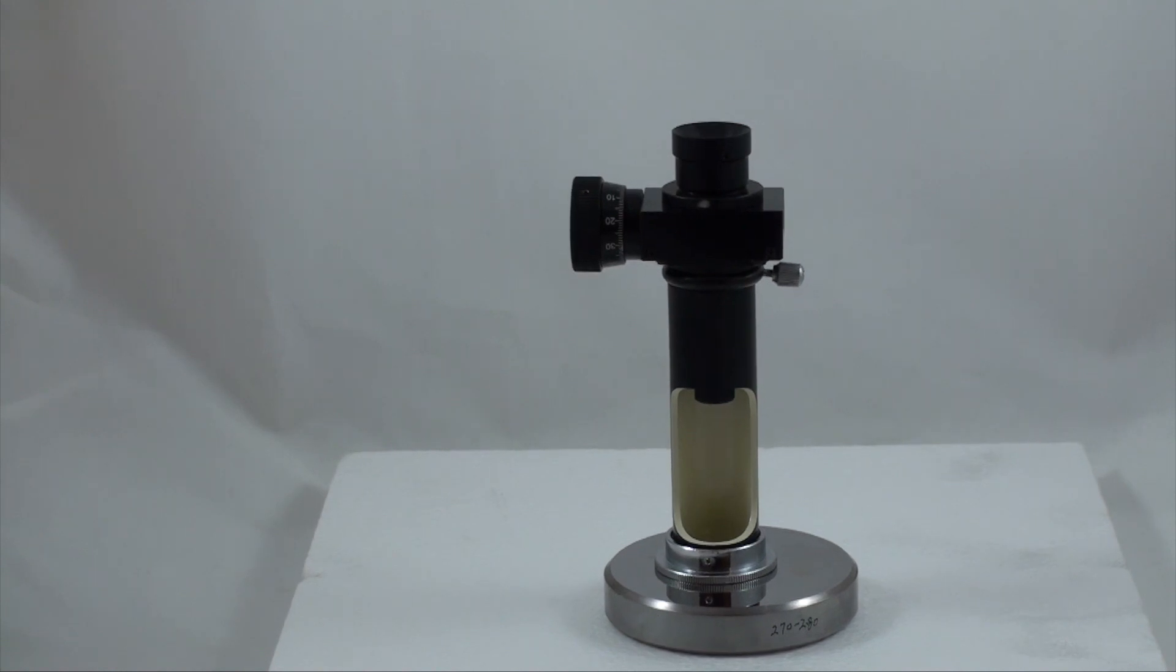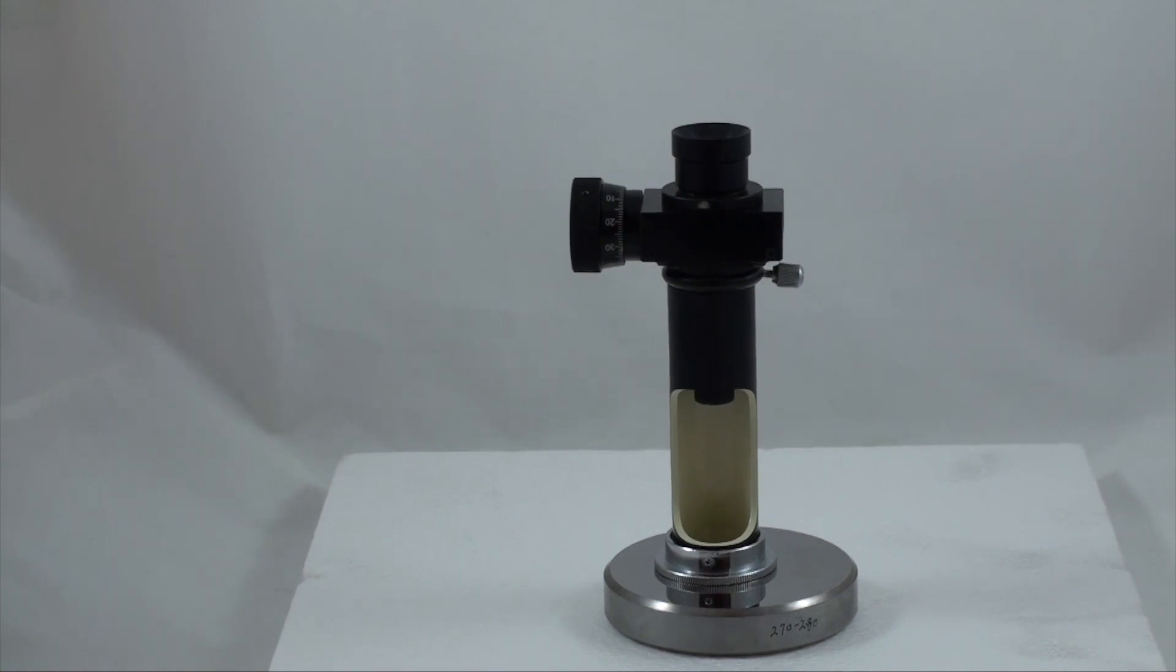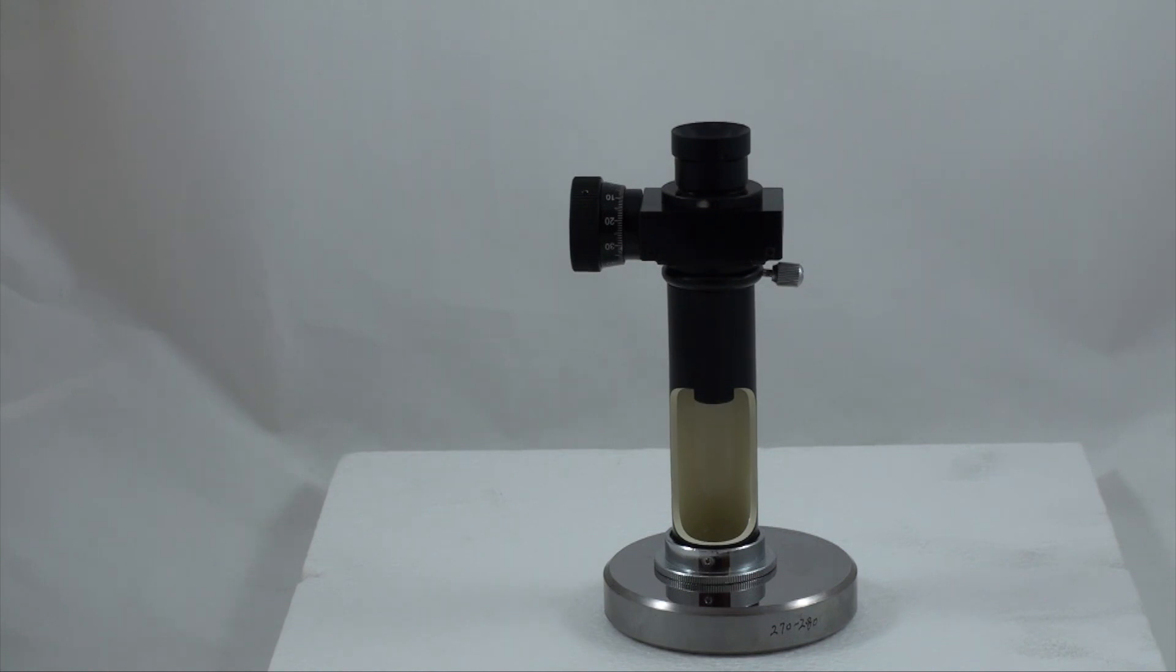Rotate the drum to take a reading. Graduation lines are printed on the drum with the scale span of 0.005 mm, so that a complete turn of the drum equals 0.5 mm. There are two graduation scales in the eye lens, one fixed and one mobile. When the drum starts to rotate, the mobile scale with the black line moves simultaneously, and the indent can be measured in the following manner.